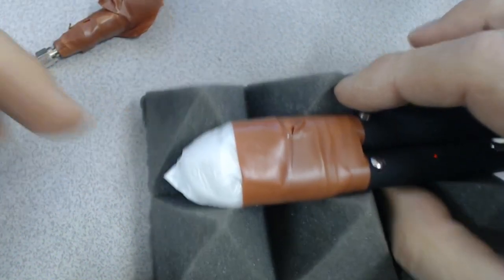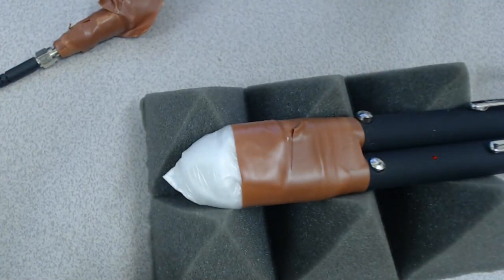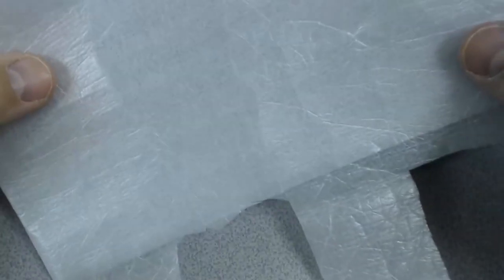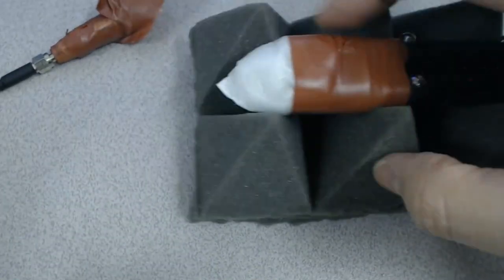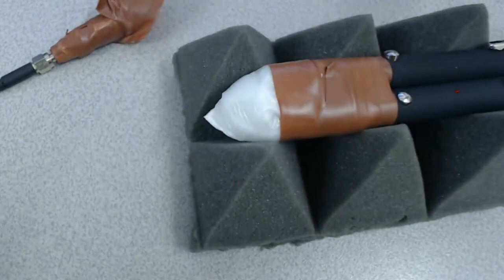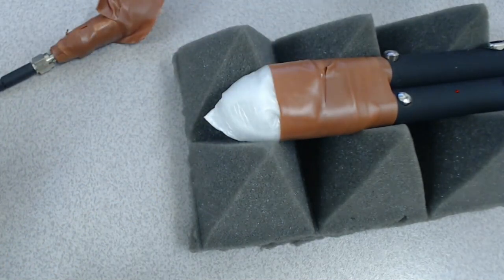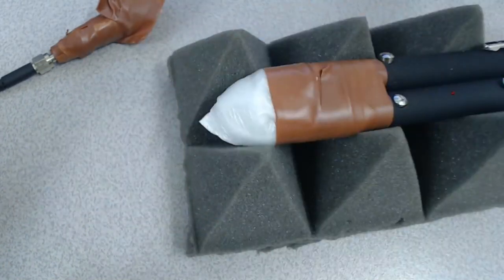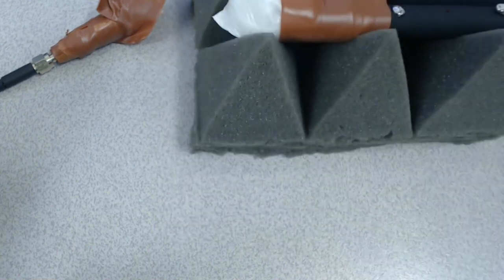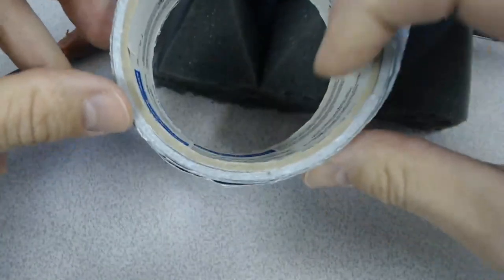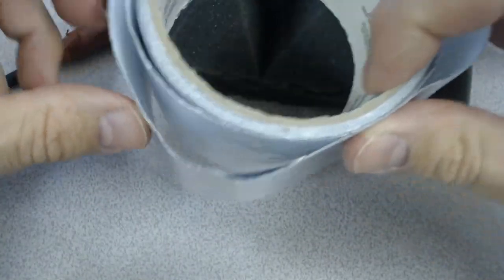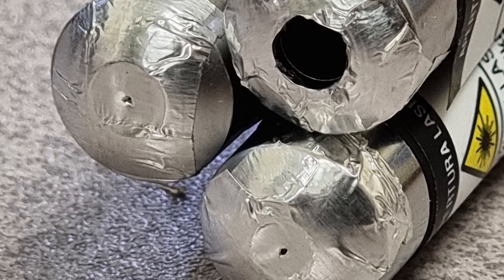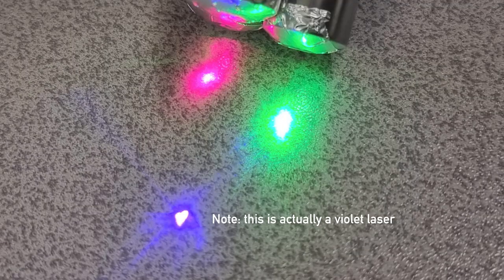And what I've done is I've put some polystyrene packaging over here because it was far too bright. And some of that screwed up inside and masked on using this electrical tape. And in fact, over the end of the lasers, I put some foil like this, some sticky foil, and just put a pinhole in it for the green and the red laser because they were just far too intense. And that means that I should be able to give you a spectra.